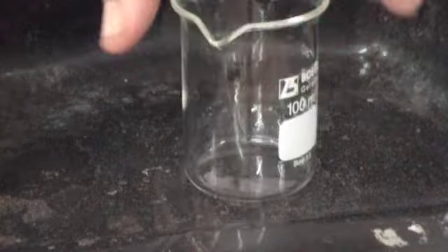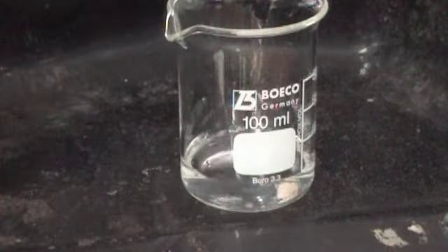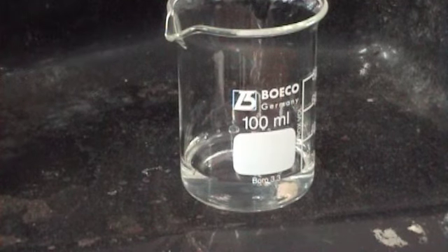Okay, so that's the first one done successfully. We have shown it's magnesium sulfate. Of course we could have just looked at the label. Never mind. Okay, the next one is zinc sulfate, which in terms of an anion is going to be a similar test, but the cation is going to be a little different, isn't it? And hopefully it'll work fine. If it doesn't work fine, we're in deep trouble.